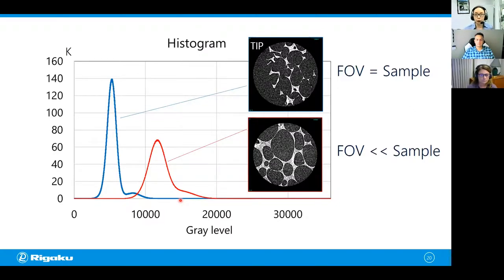This happens because when you have a bigger sample than the field of view, even if you don't care about the part outside of the field of view, those areas are still absorbing x-rays, reducing x-ray intensity, also changing x-ray intensities. And that's why when you have a whole lot of volume outside of the field of view, you tend to see a higher level of noise. So you want to make your sample a little bit bigger than the field of view, but not like 5-10 times bigger than the field of view. You want that to be just right.